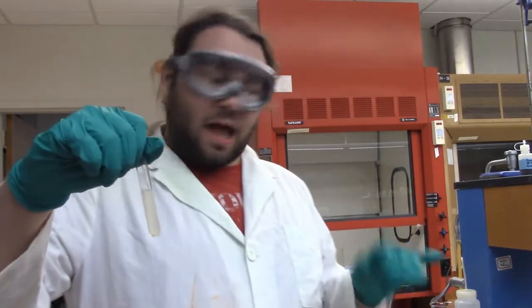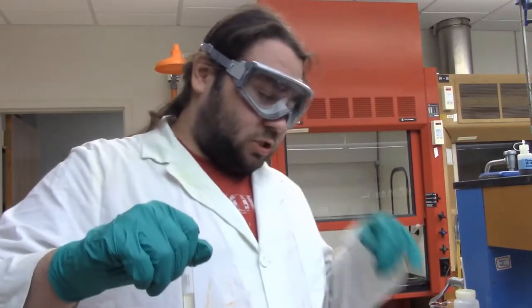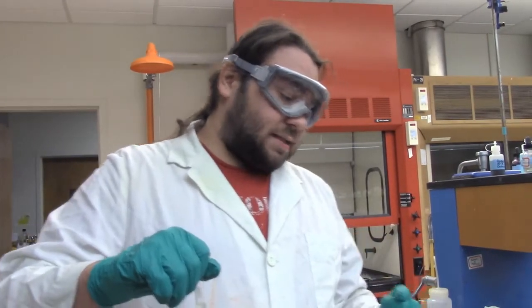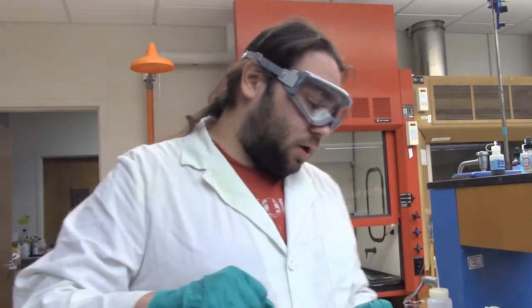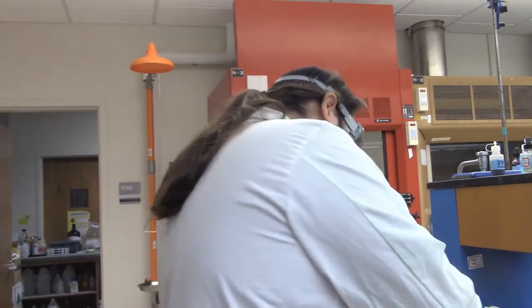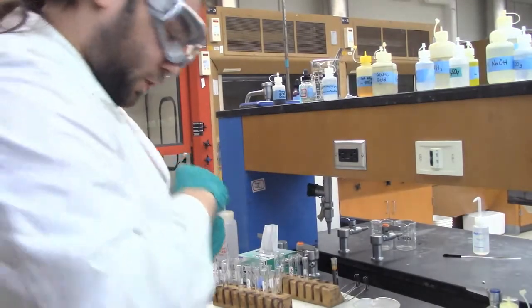So, give it a good mix. And I'll heat it. And I'll come back to you in a few minutes when we test for the manganese. Alright, so I did a couple of steps off camera. We did have a bit of a precipitate, not a whole lot, but a bit. So I used the precipitate for the manganese, suspended in water, added the acid and the H2O2 and did all that. And now we're up to the NaBiO3, which I don't actually know the proper name for, so I'm just going to call it NaBiO3.